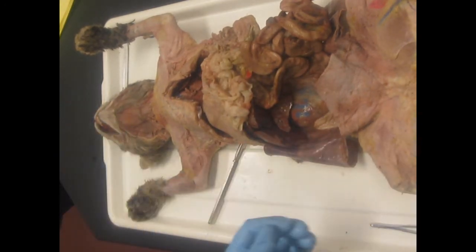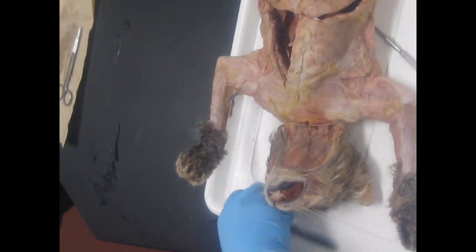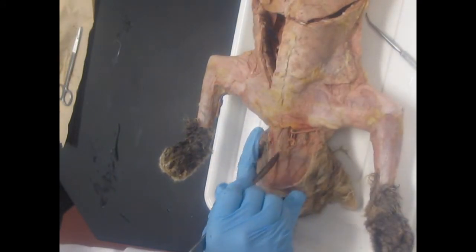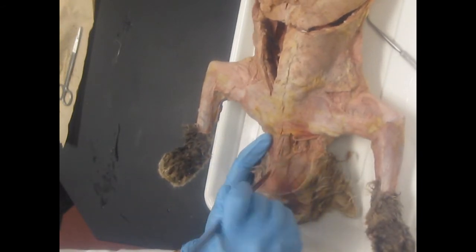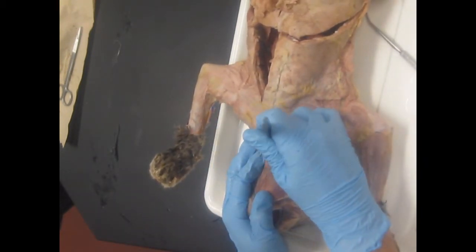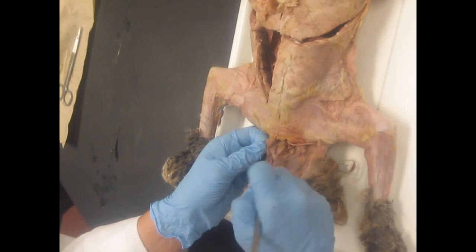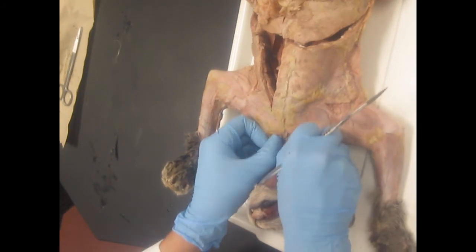Thyroid. Alright, so for thyroid dissection, you have to do a muscular dissection in the neck. I'm going to turn this guy this way. And what you're going to do is make gentle incisions along the muscle of the neck and then push the tissue away. If you make too deep of an incision the first time, you're going to cut right through the trachea and the larynx, and then you're going to lose some lab points. So you do light incisions and push the tissue away, see what you've got and how much deeper you need to go. Okay, light incision, push the tissue away.